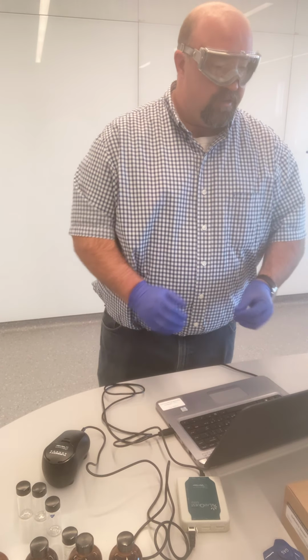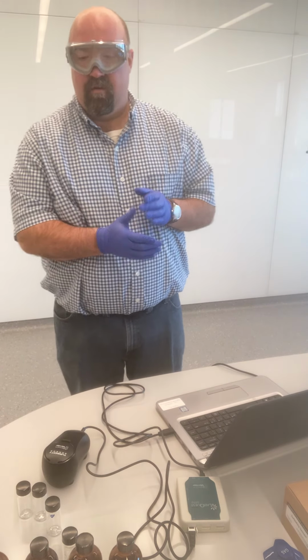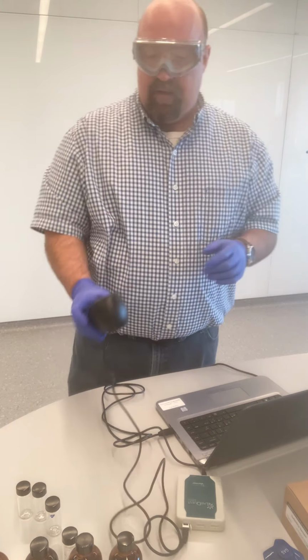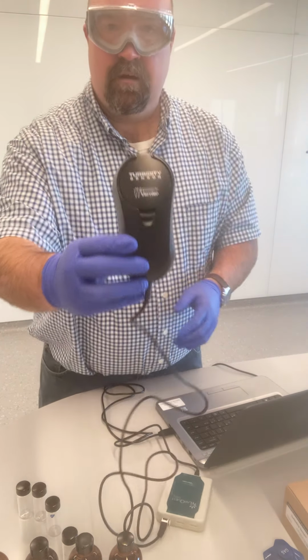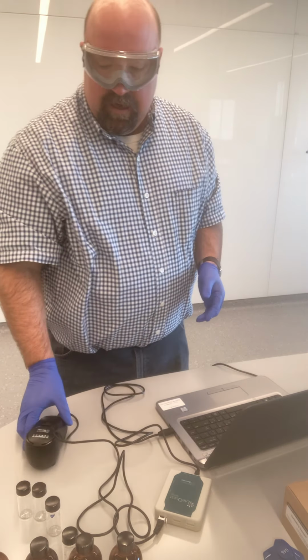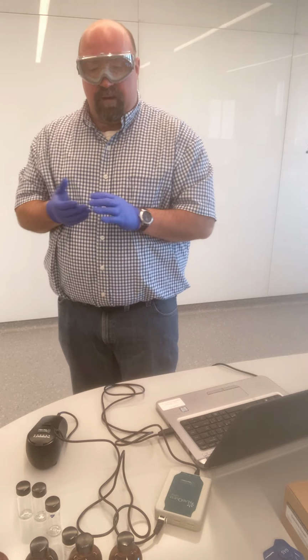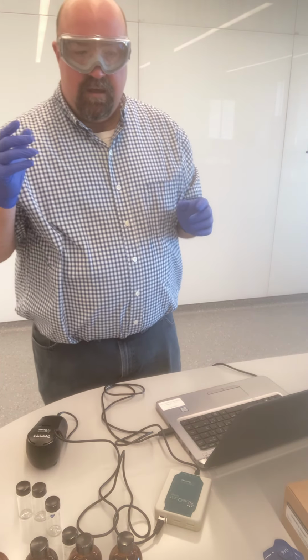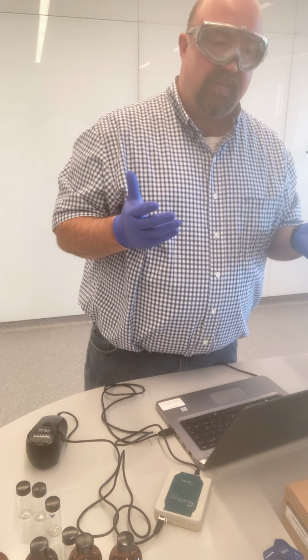And now we're going to measure the turbidity of the 5 Green River sample spots. In order to measure the turbidity, we're going to use a turbidity sensor. It even says so right there, turbidity sensor. And we talked about this in pre-lab a little bit, but the basic way that a turbidity sensor works is we're measuring the amount of cloudiness.